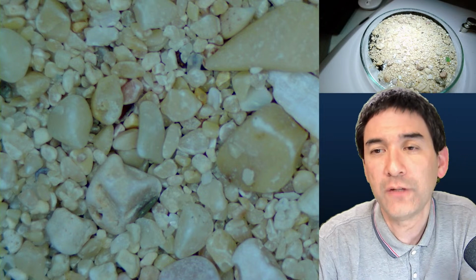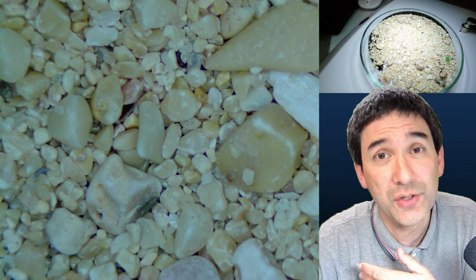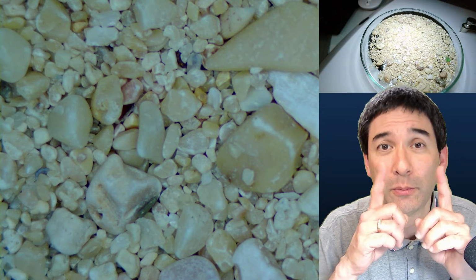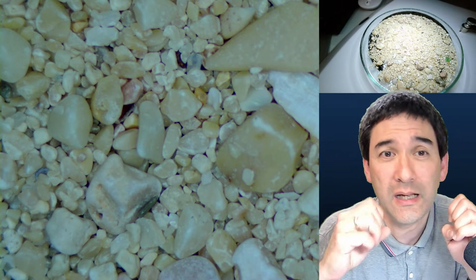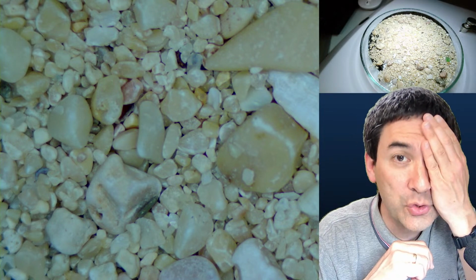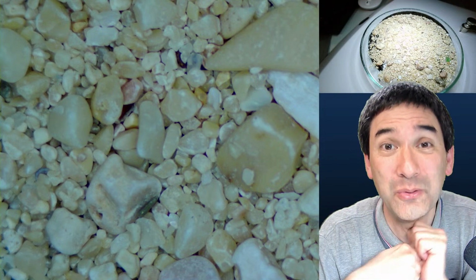Yes, especially, children sometimes, and we see this also in the school where I work, especially younger children, have a problem actually using both eyepieces. Sometimes they see double images and they don't know how to adjust it properly. And in many cases the kids simply close one eye and observe through the microscope with only one eye, because then you're able to see at least something.